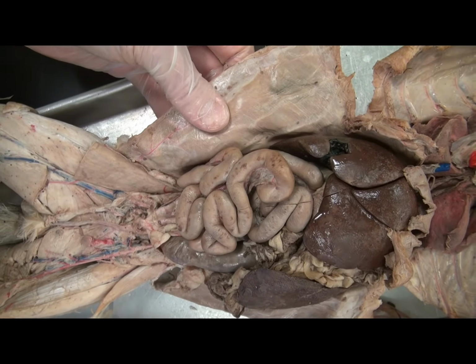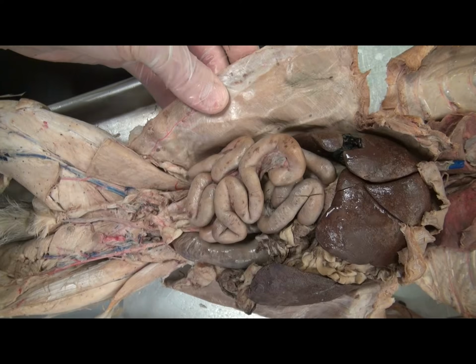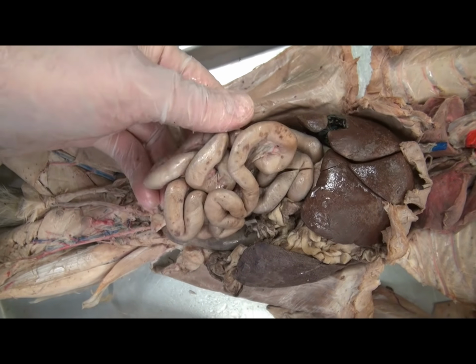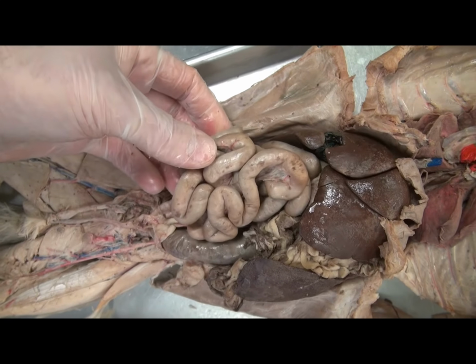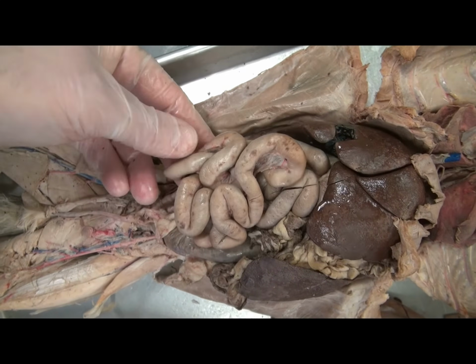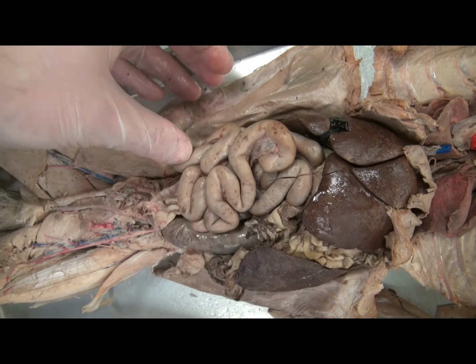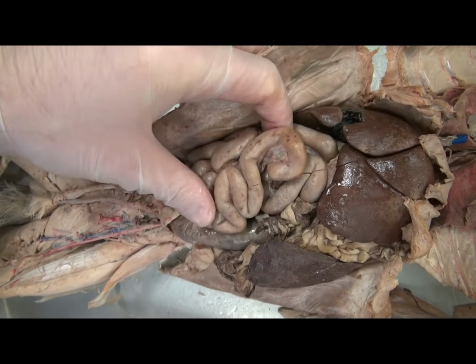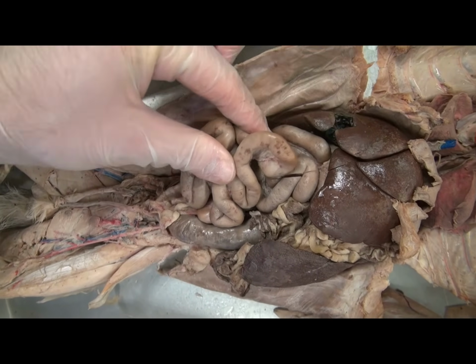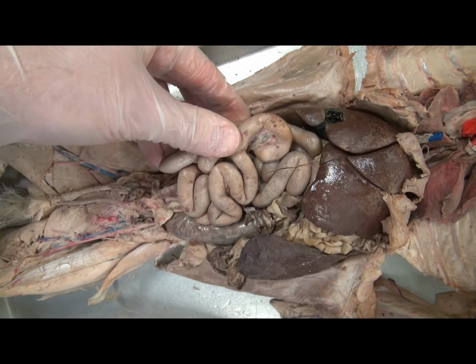This makes up the wall of the abdominal pelvic body cavity. And the organs themselves are covered by a visceral peritoneum. And because we have these two smooth layers and a lubricating peritoneal fluid in the peritoneal cavity between them, these structures can move. Digestive structures can move relative to each other and the body wall without blisters and adhesions.